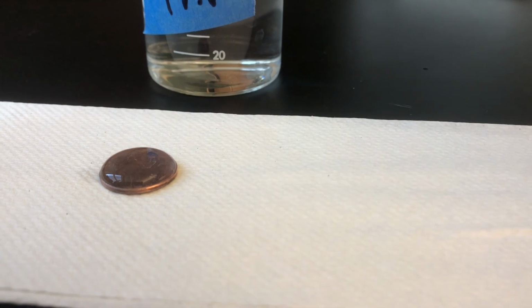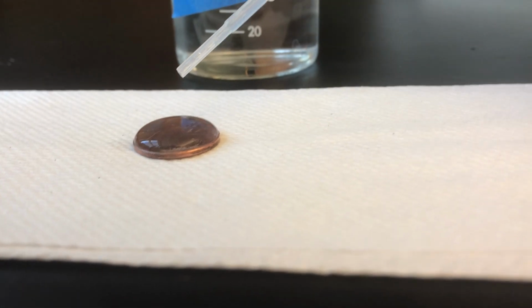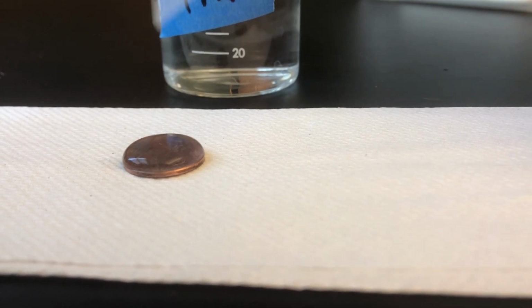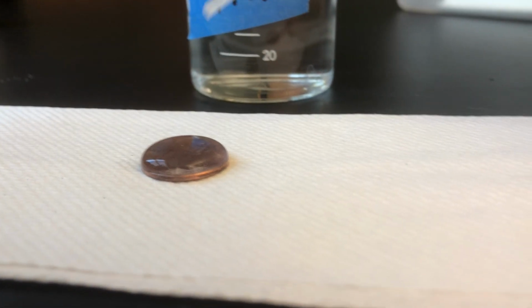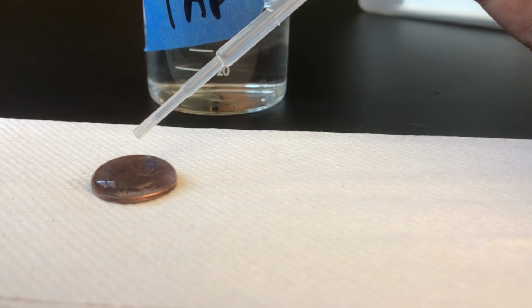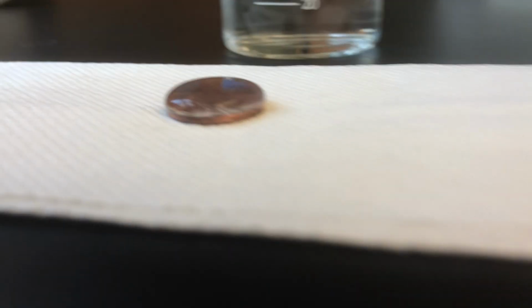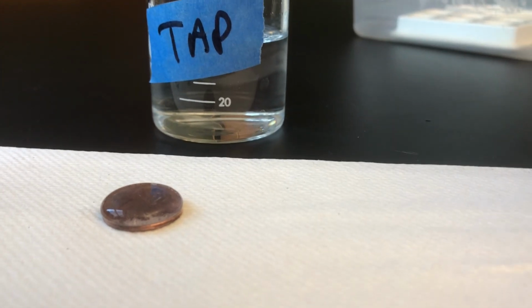So let's keep going. I left off at number 20. Here we go, 21, 22, 23, 24, 25 drops. And you can see it still has not spilled. All right, 25 drops, let's keep on going. 26, 27, 28, 29, 30 drops. And you can see the water is still not spilled off the penny. So we're up to 30 drops.